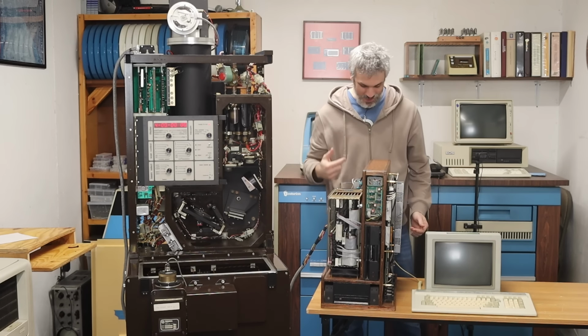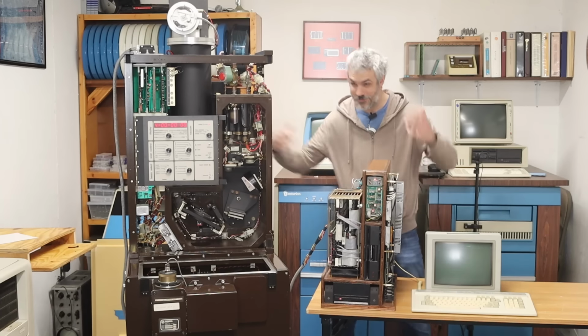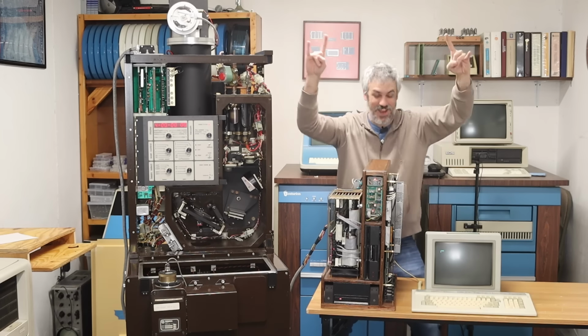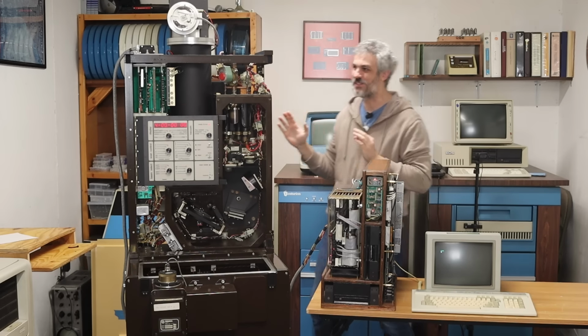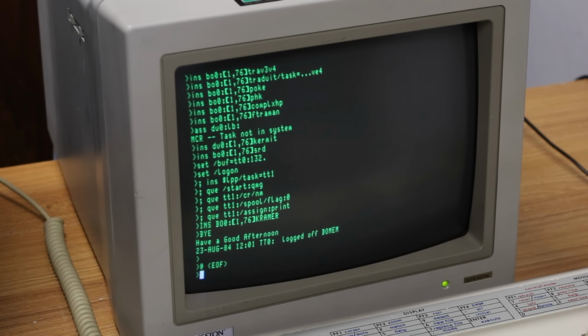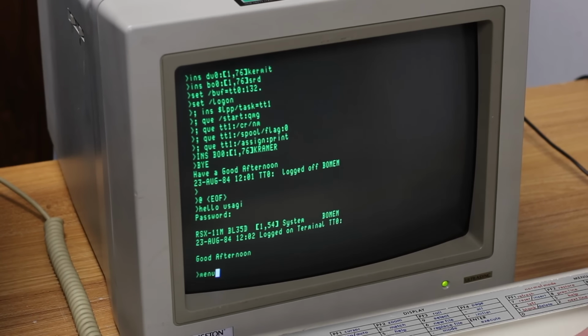Let's turn the PDP-11 on. There we go. All right. Let's get into the software and see if we can make it do something. All right, we're fully booted back up. Let's go ahead and log in. So I'll do hello Usagi. The password is Usagi if somebody wants to break into my PDP-11/73 here. And then we're gonna go ahead and type menu to load into the Bomem software.